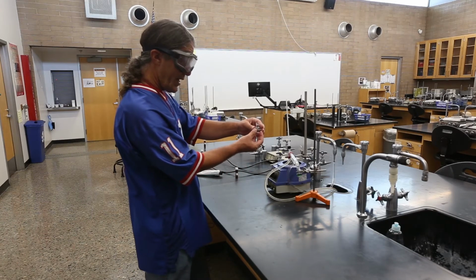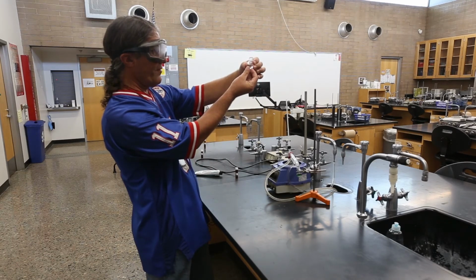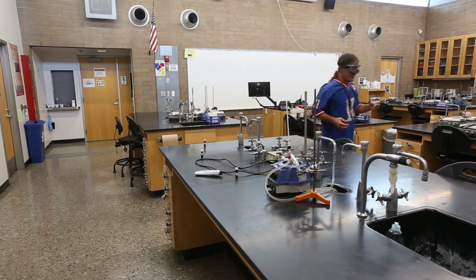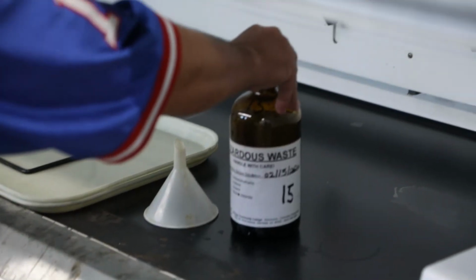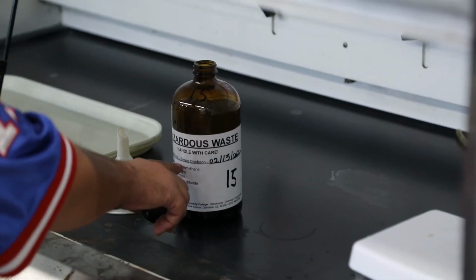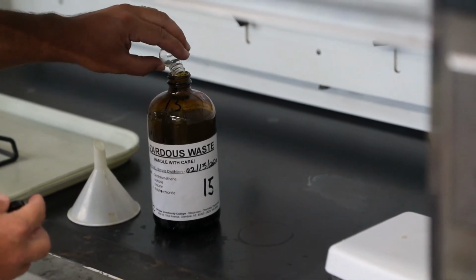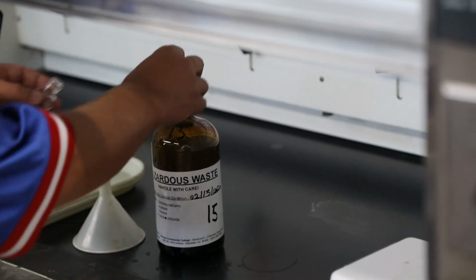What I'm going to do right now is just go dump it in the waste, because although this is gloriously purified and we know it all distilled at the same temperature, we're done with it. It served our purpose. And you always want to dump the waste in the appropriate waste container. So in the hood, we have the hazardous waste jar, and it does say on it dichloromethane, acetone, hexane, and butyl chloride. Those are the organic materials that we use in the distillation lab. So go ahead and carefully put that in there.